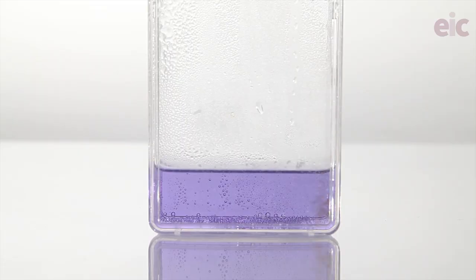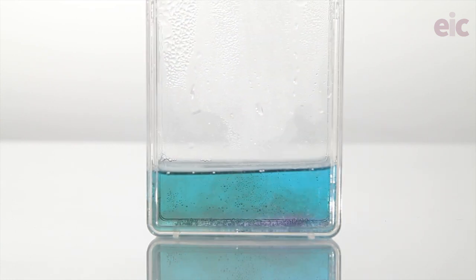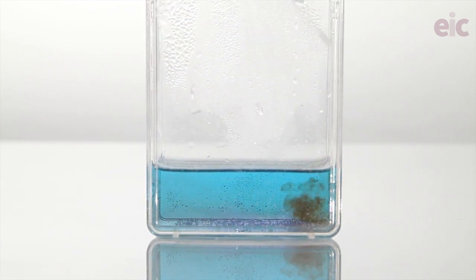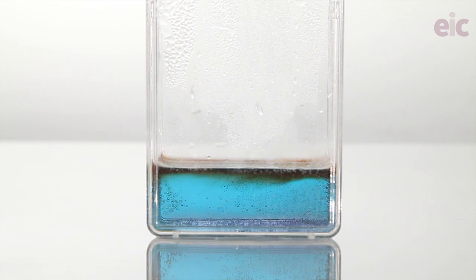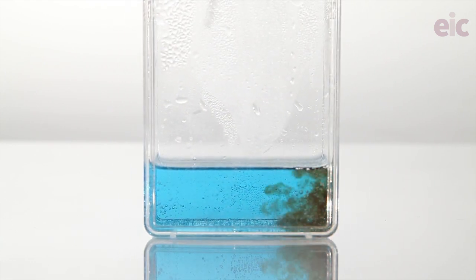You can, of course, now re-oxidize with 10-vol hydrogen peroxide or 0.1 molar acidified potassium manganate 7. In the former case, you'll produce the pleasingly titled oxo-peroxo vanadium 5 ion. That sort of blood red color gives us a final flourish.